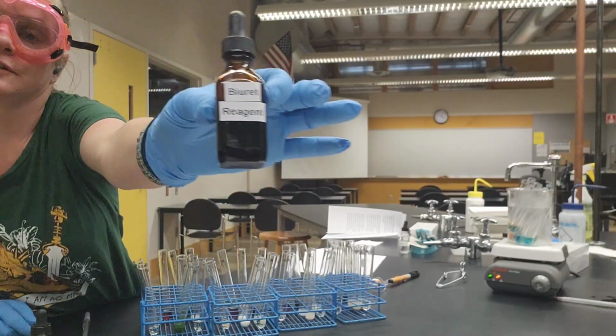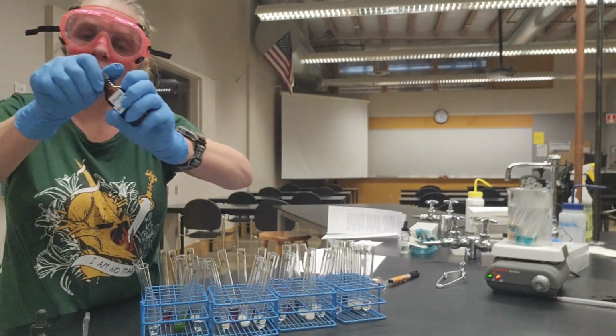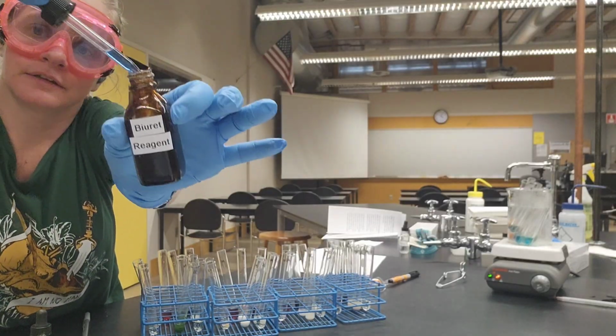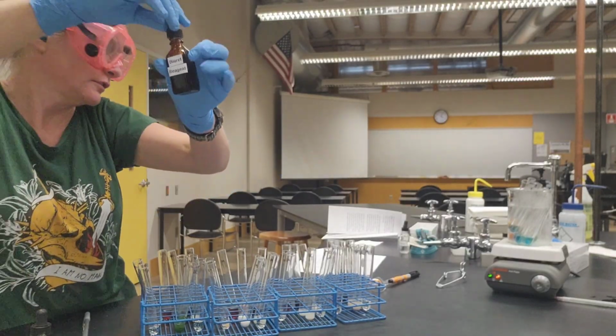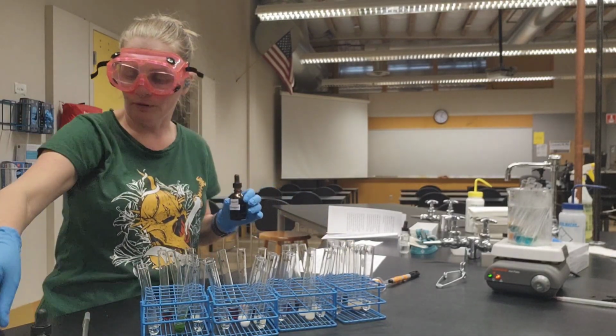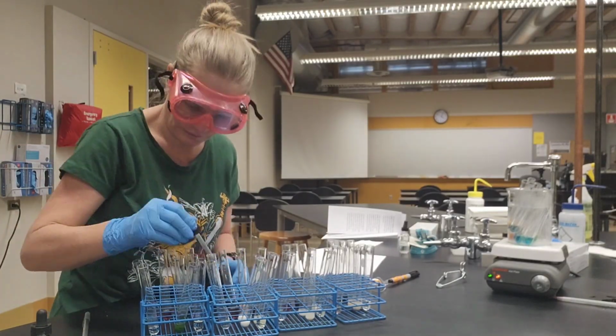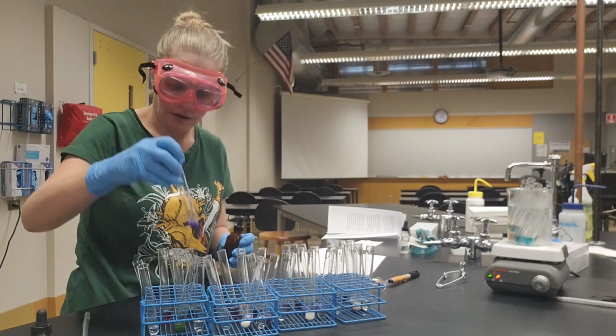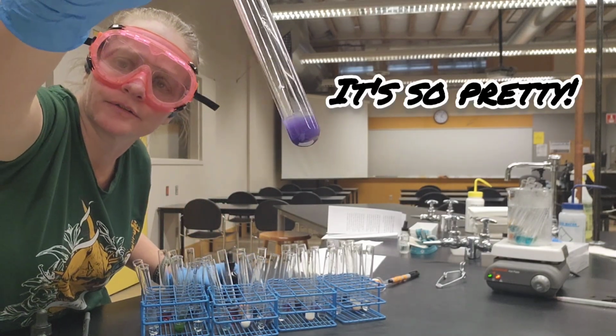All right, our next test is for proteins, and in this case, we're going to use the Biuret solution. If this is a positive result, we're going to see it go from this nice blue color to more of a purple. And just for reference, this is our positive control.